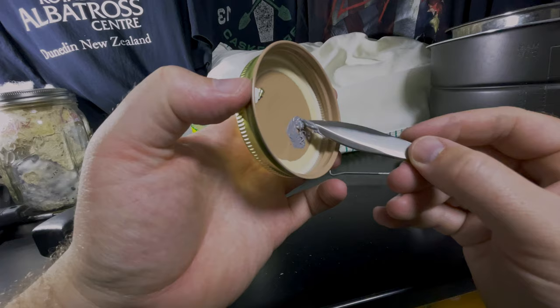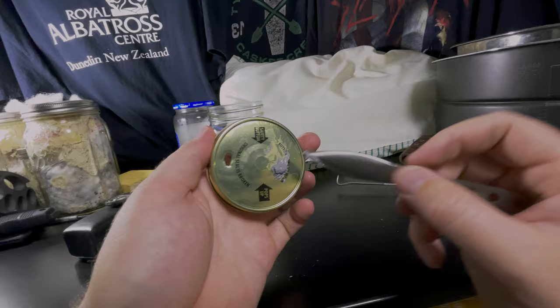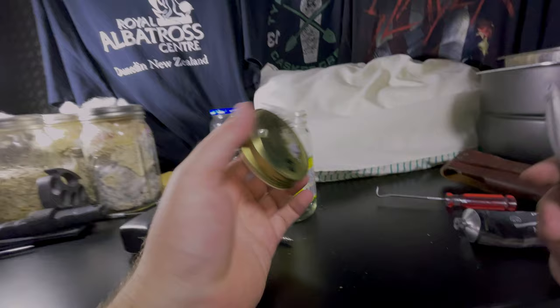I don't care about the inside. I'm not aiming at the inside. When I'm aiming to stab, I want to know roughly where the center is. So it is a little helpful to clean this out, but it doesn't really matter because you'll just poke around with the needle until you find it. So there, that's one jar glued. And now you wait for it to dry.